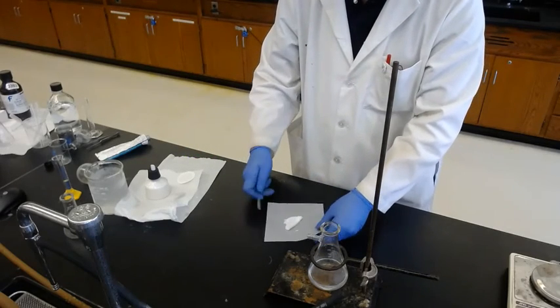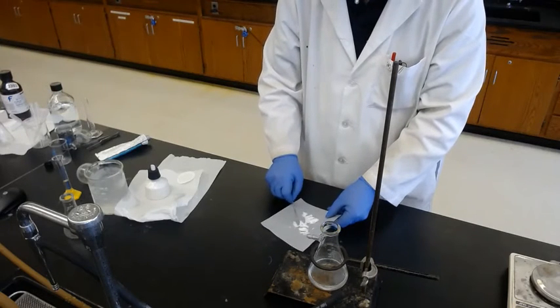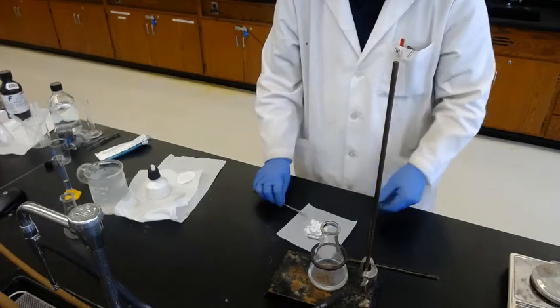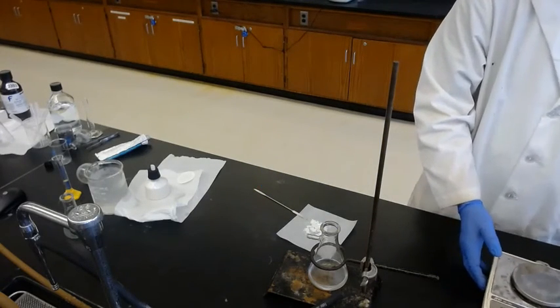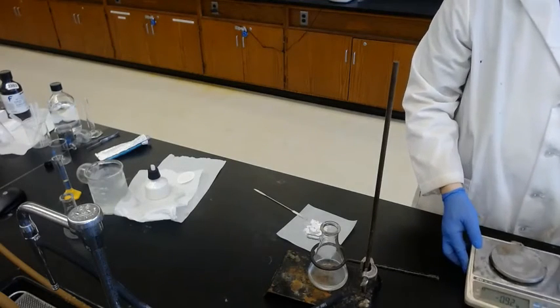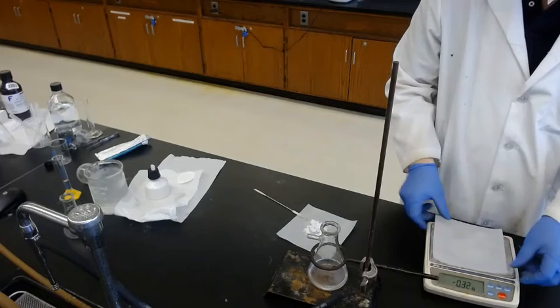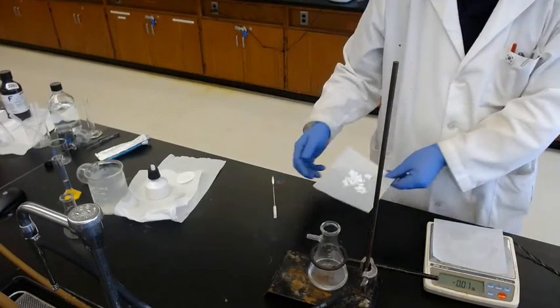And ethanol is easy to dry, so assuming this is dry, because we left it under the vacuum for about a minute. Okay, then go to the balance. Okay, where's the balance? Go to the balance. Weigh the paper, make it zero. Now we transfer.